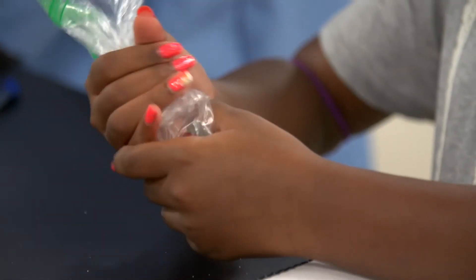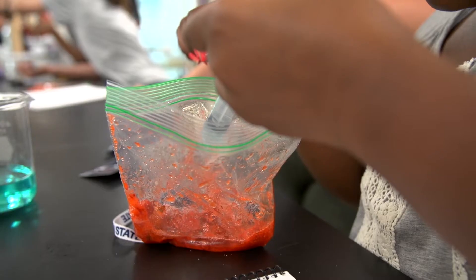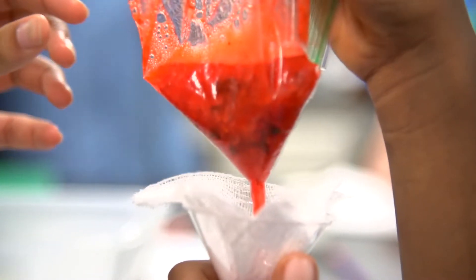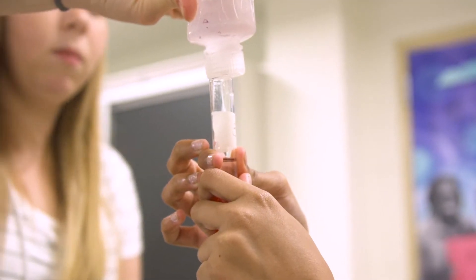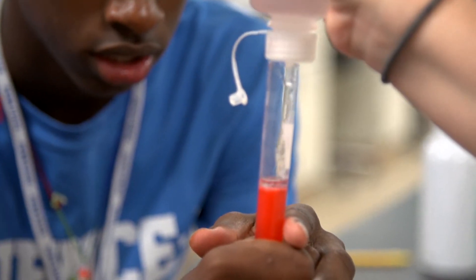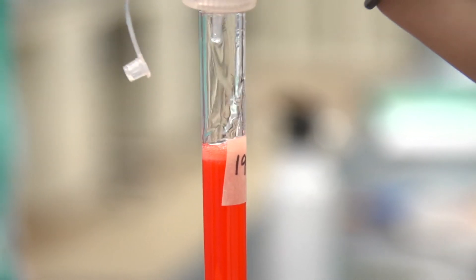Get the air out of the bag — now we're going to mash it. Yours is condensing quickly — do you see that? That's all DNA. One of the advantages is showing them that living organisms have DNA, and we share this in common. In fact, something like 70% of strawberry DNA is represented in human DNA.